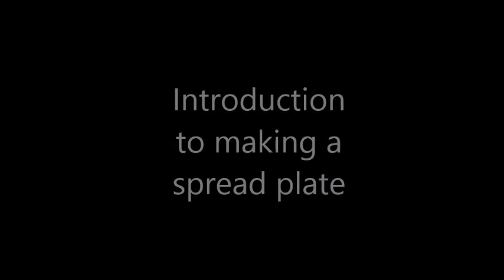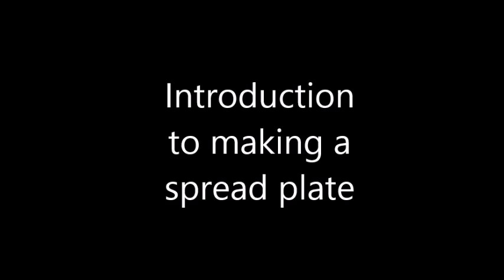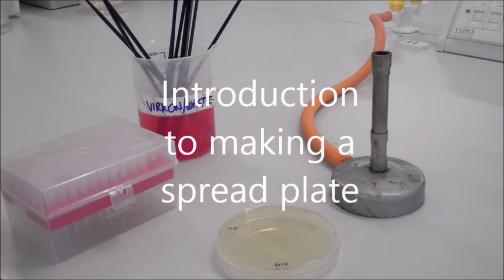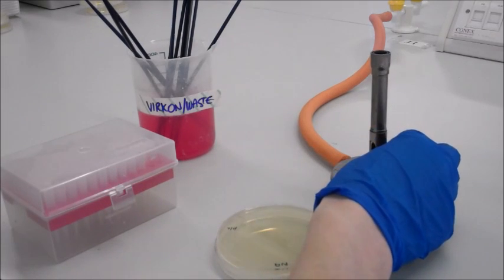In this video, I'm going to take you through the correct procedure for making a spread plate using E. coli and how to achieve a good aseptic technique while doing this. So after you've disinfected the bench with Virkon, you need to make sure you work in an area close enough to the Bunsen flame, as this is a very common problem that people don't often do. You should always work around a blue flame.